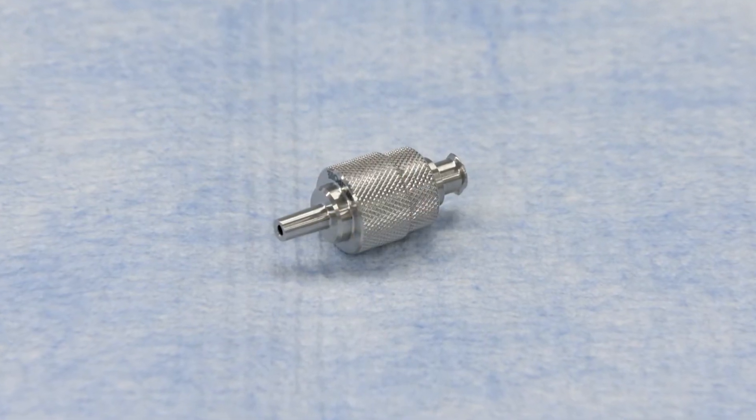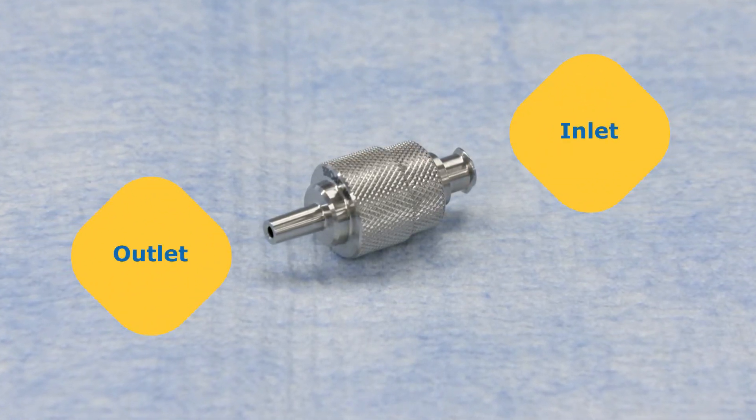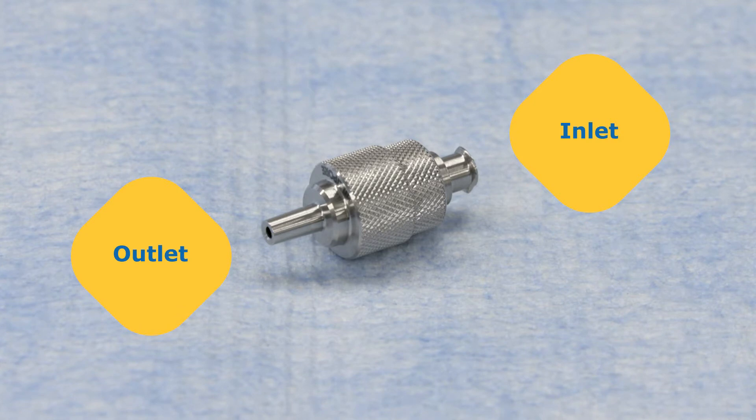The filter holder can be autoclaved with a filter in place for clarification and sterilization applications that do not require removing the filter intact for further use.